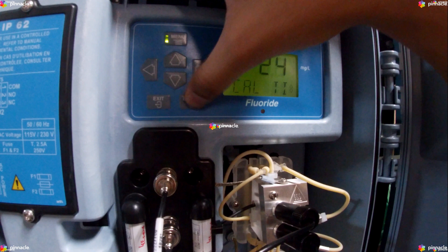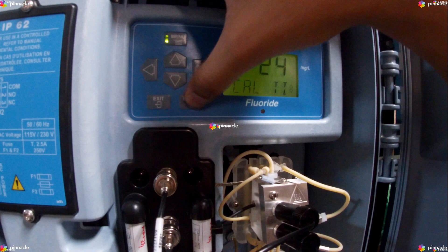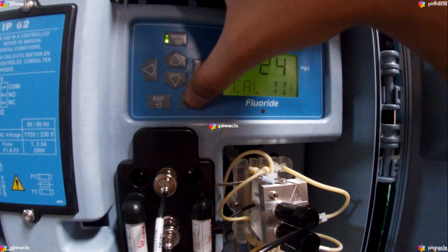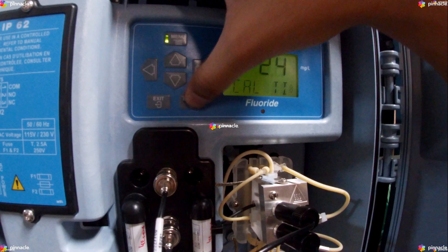The CalTime option sets the time interval between automatic calibrations. The default is set to 24 hours. The analyzer automatically calibrates after the calibration time interval expires. The calibration time interval starts when the analyzer is turned on or when the setting is changed. Power loss restarts the calibration time interval. The Calibration option initiates the calibration of the system.